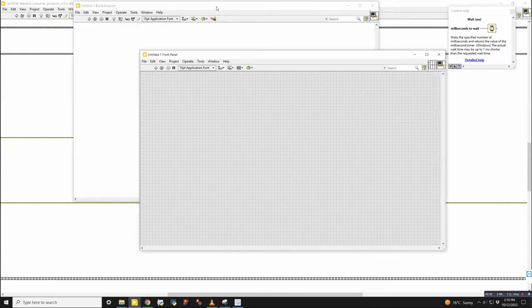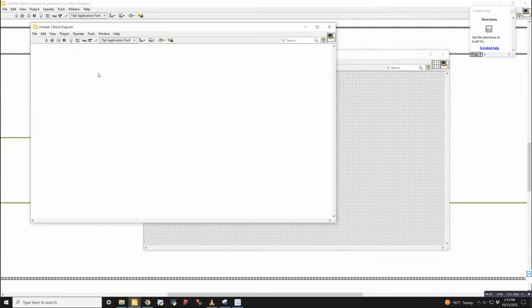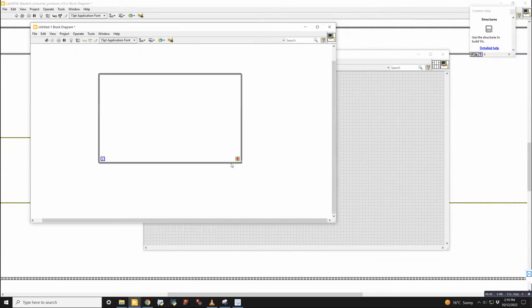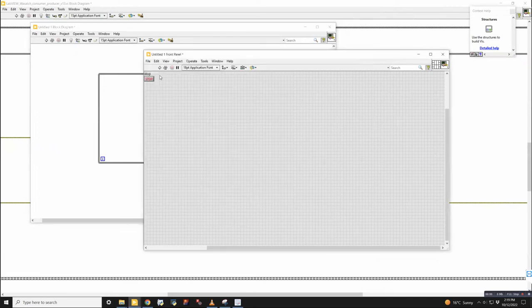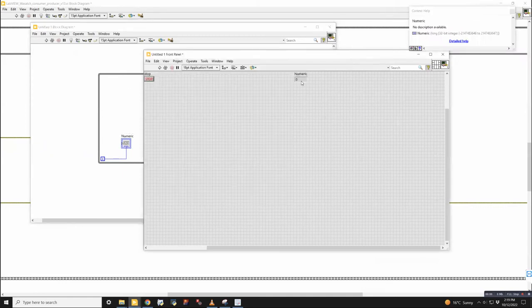I love that. Yeah, so what I'm going to do here is set up a while loop. I'm going to create a control, which is just a stop button, and when I click this, it's going to stop. And then over here is the loop counter, so I'll create an indicator here. If I run this, every time the loop executes, this number will go up. So this is the most simple loop that you can possibly do.